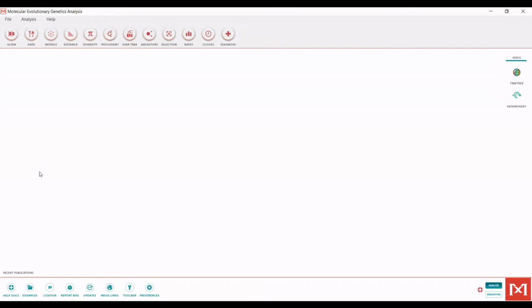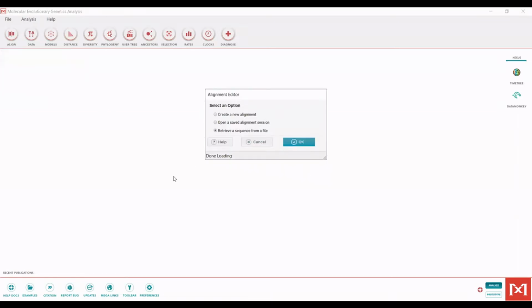So what we are going to do is I have saved those cleaned sequences from BioEdit into a separate cleaned folder, as I said. And so now we are going to align them. So at the top here, you hit align. We are going to edit slash build an alignment. And so a little window will pop up, which I don't think shows up in the Zoom screen, but it will tell you to select an option to either create a new alignment, open a saved alignment session, or retrieve a sequence from a file. And so I always start with a clean alignment. So I say create a new alignment, and then you hit OK.